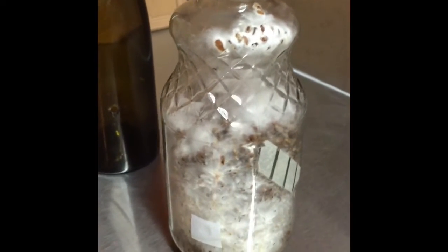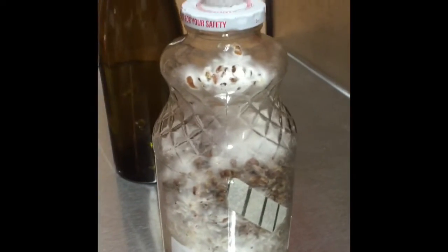We will be able to seal up the holes and autoclave them. Here's one of our wine bottle kits — as you can see it's got three holes in it.